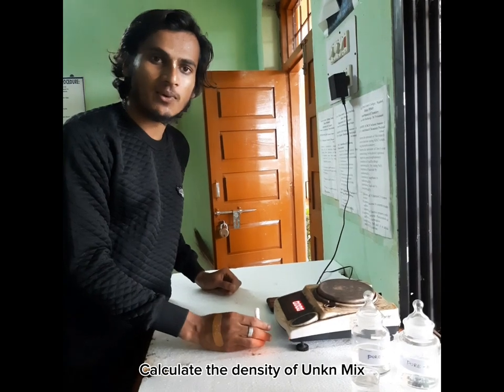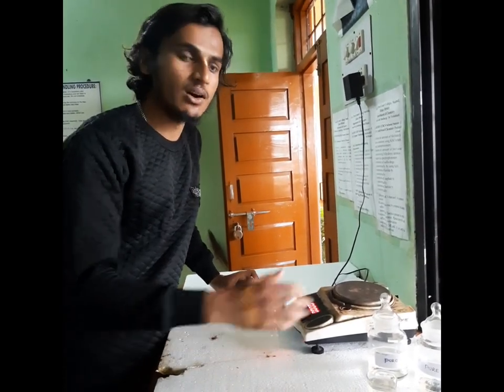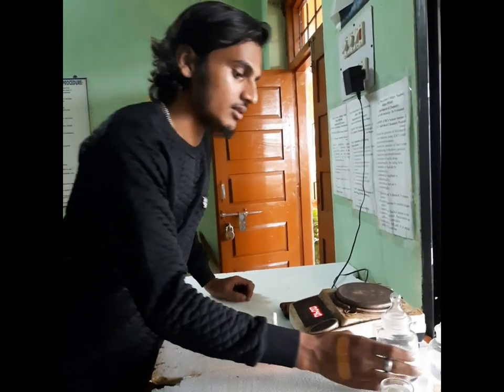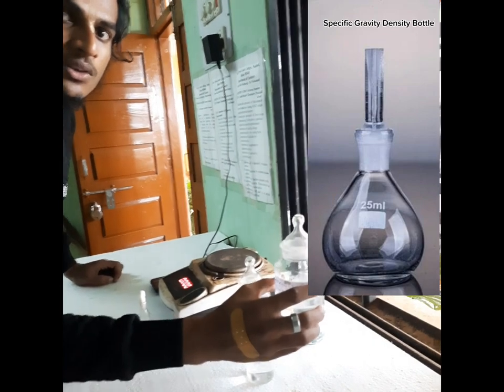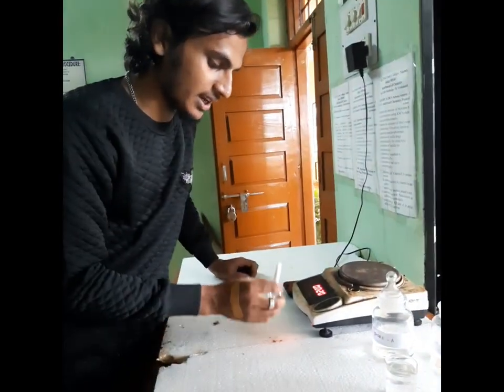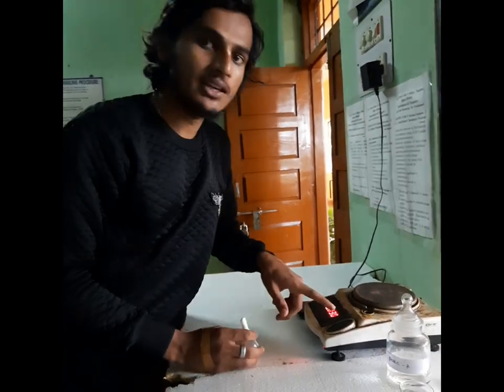After taking the readings from the Abbe refractometer, we need to calculate the density of these three liquids. To get the density of pure A and pure B, we need to calculate using the formula: weight of liquid by weight of water. For the unknown mixture, we need to calculate the density by using this specific gravity bottle and the weight of water.